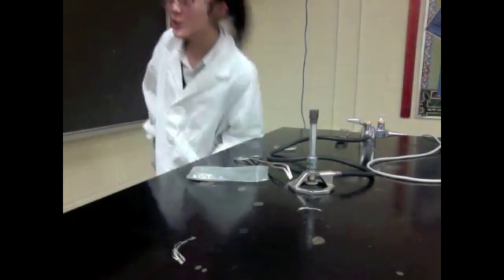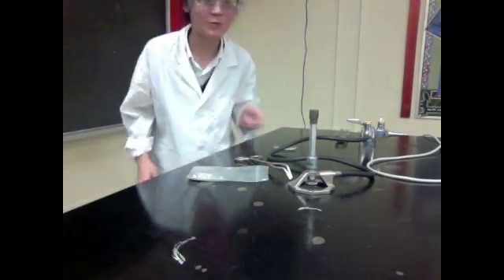The first thing you're going to need are safety goggles and your lab coat. Also, if you're a girl, tie your hair up like me so you don't want to get it all burnt.